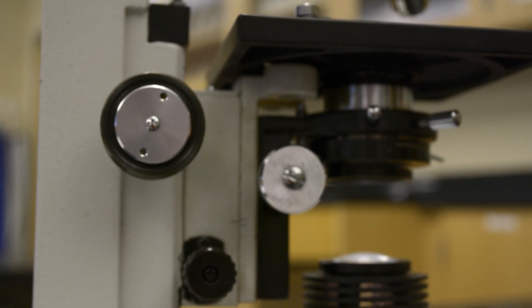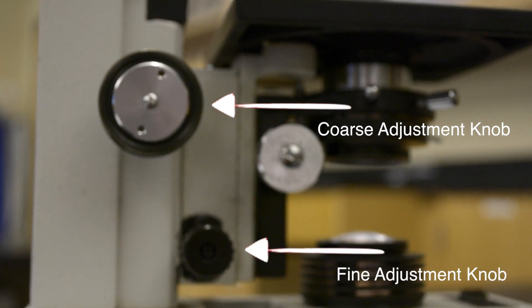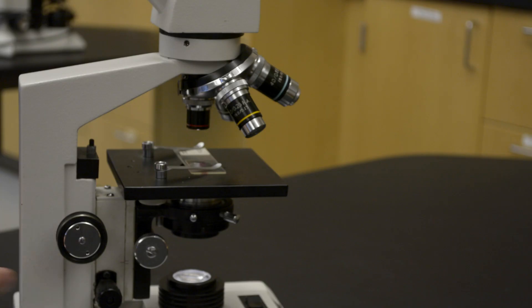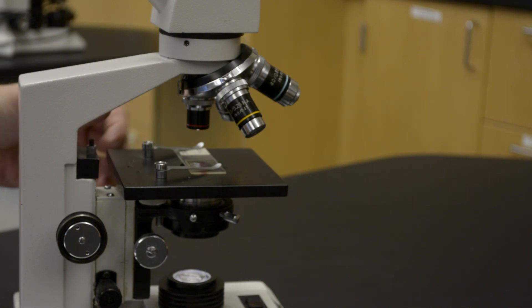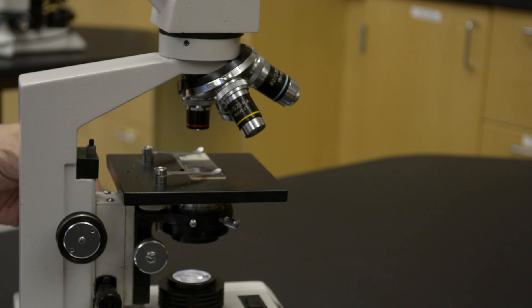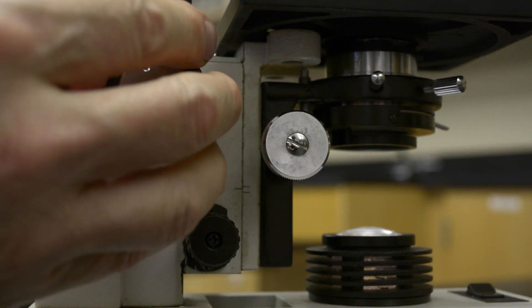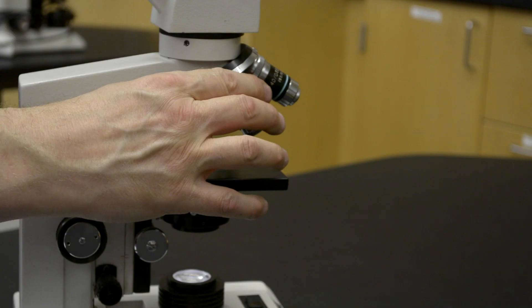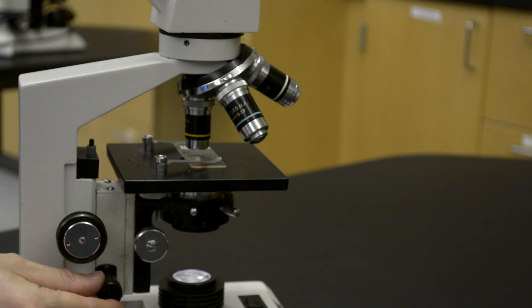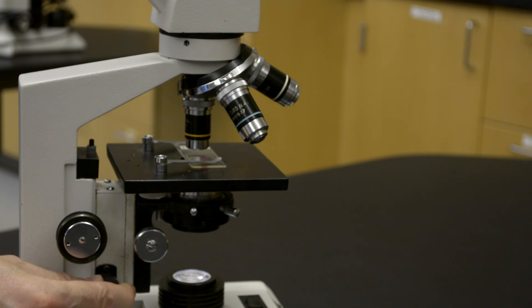There are two knobs found on the microscope that you can use to focus the image you are looking at: the coarse adjustment knob and the fine adjustment knob. The coarse adjustment knob is only used when you are using the scanning objective on the revolving nosepiece. It moves the stage up and down to help focus the image. Whenever you move to a higher power objective, you would use the fine adjustment knob, which only moves the stage slightly up and down but allows you to focus under higher magnification.